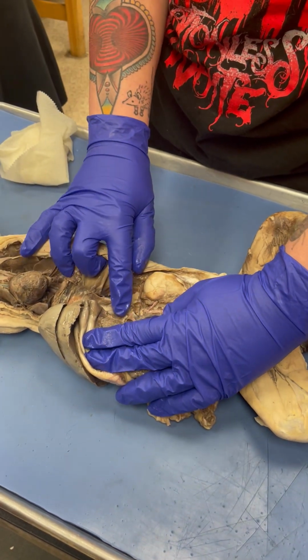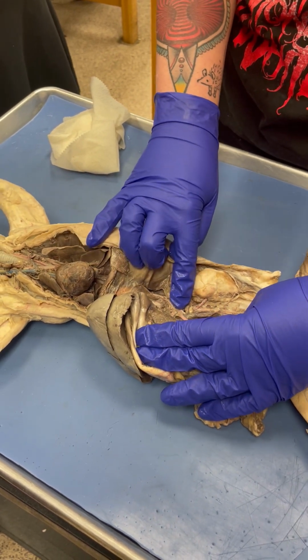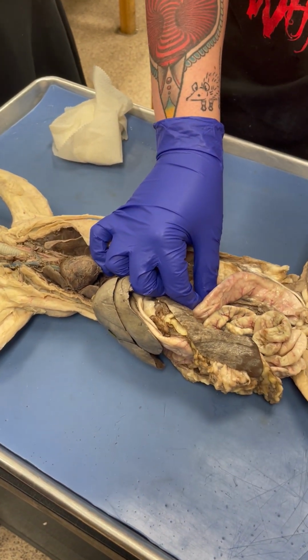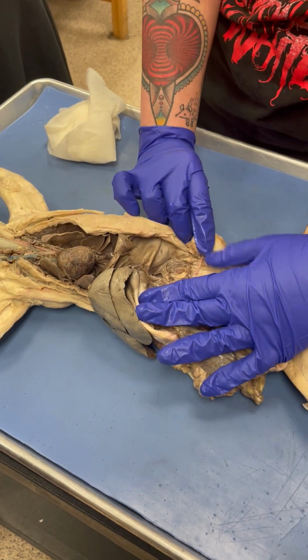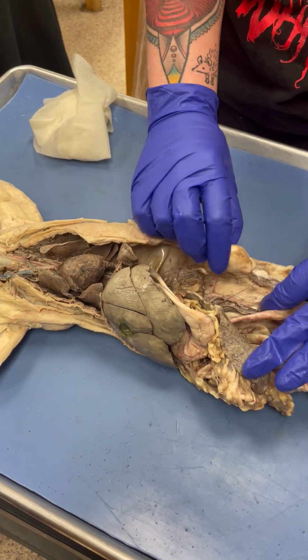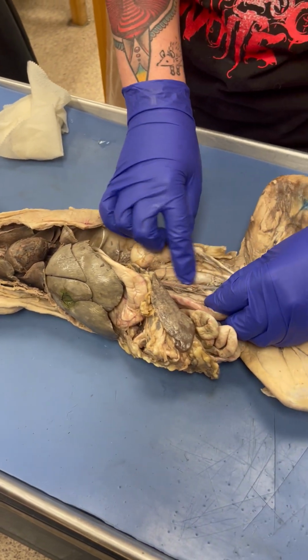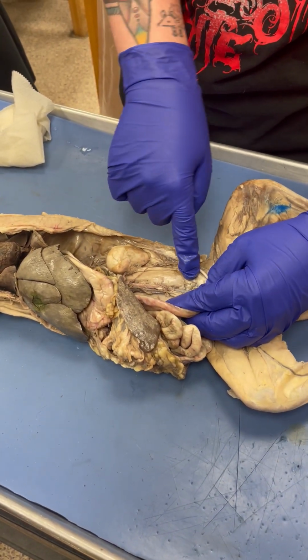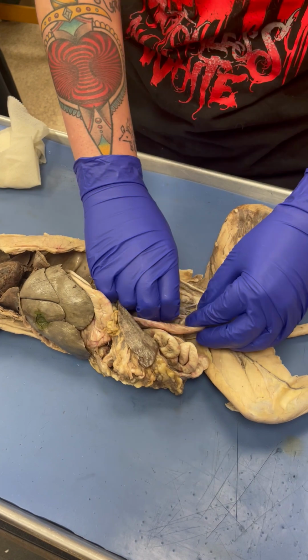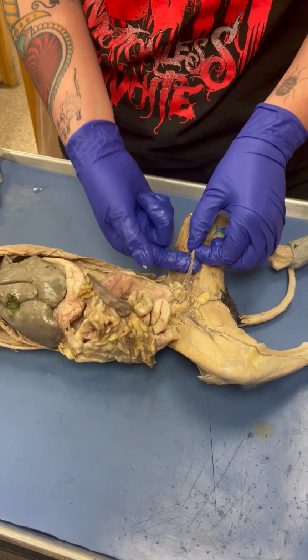So the first branch off the descending aorta here, that's the celiac artery. The second branch right here, that's the mesenteric. You'll see it's going directly to the mesentery of the small intestine. And then the one off the kidney is the renal artery. The vein is broken, but normally the vein is right there. And then the inferior vena cava and the descending aorta run down at the pelvis. They split into the right and the left iliac, and that will be iliac vein and iliac artery. And then once they run through and they're on the inner thigh, this will be your femoral artery and vein.